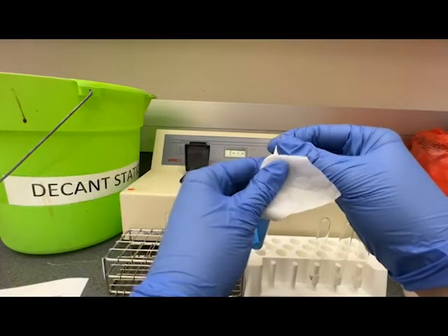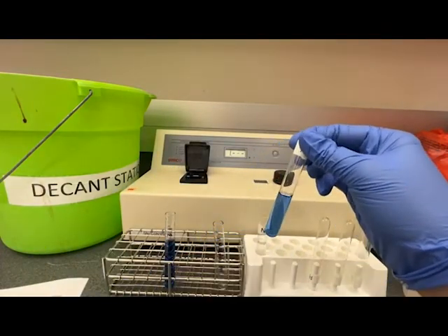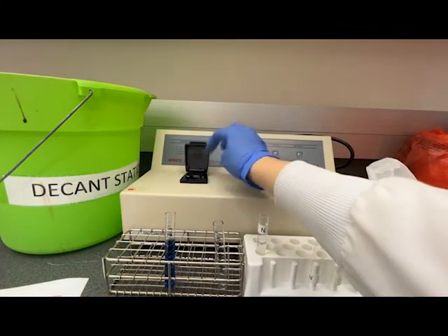And then wipe it with a Kim wipe and insert it into the chamber and close the door.